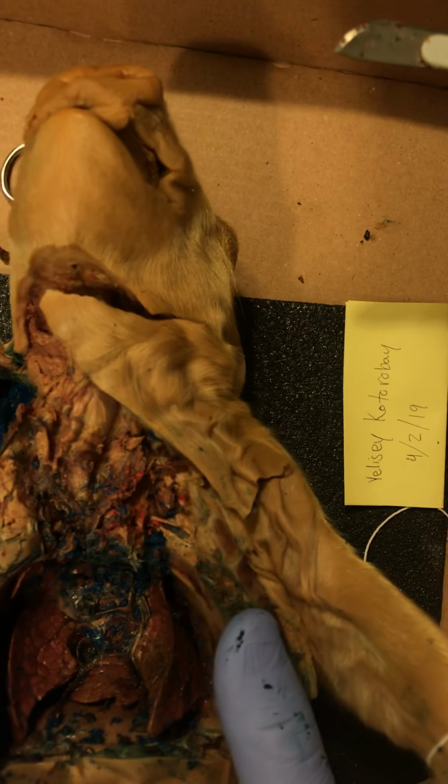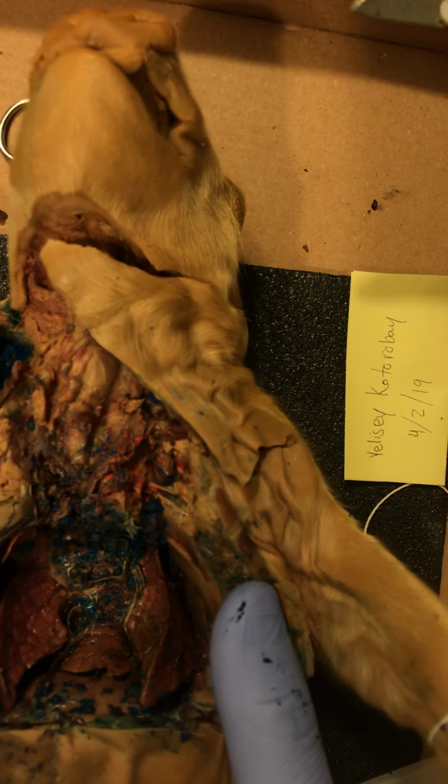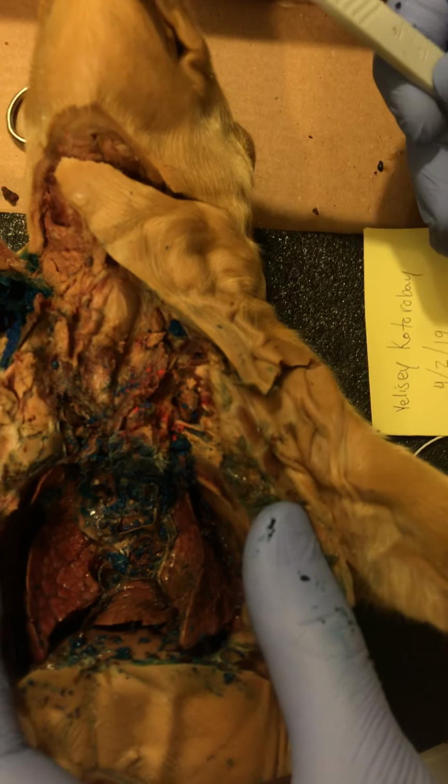The second photograph is going to be of the various lobes of the lung. So I'm going to move like so. Just try to center that there. Tap on the darkest part of the picture to get the focus in.